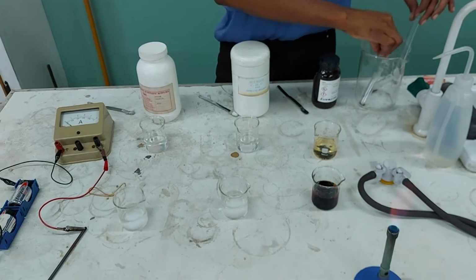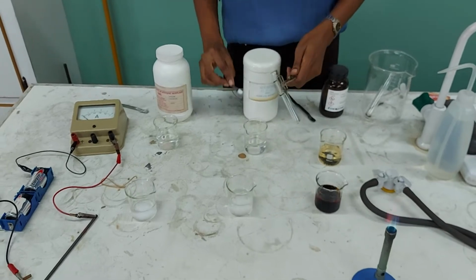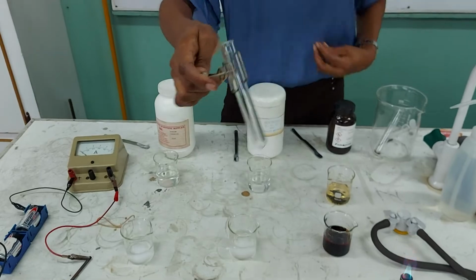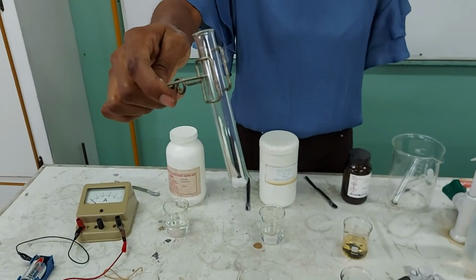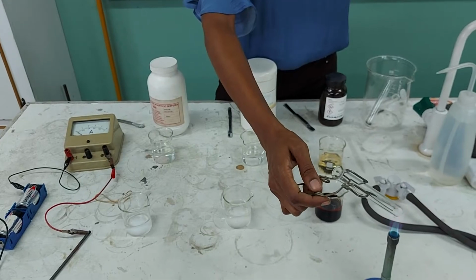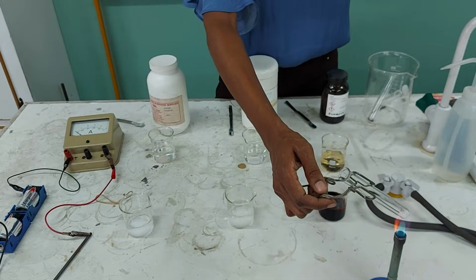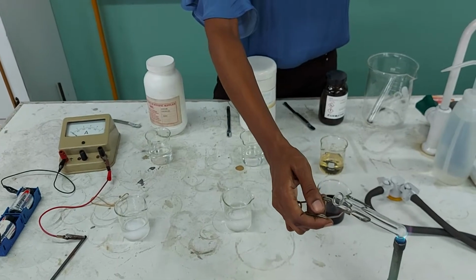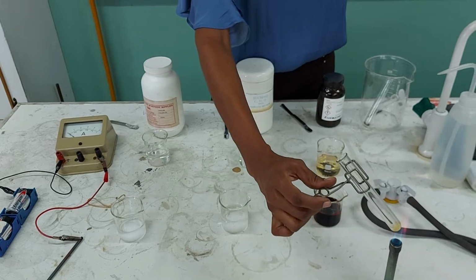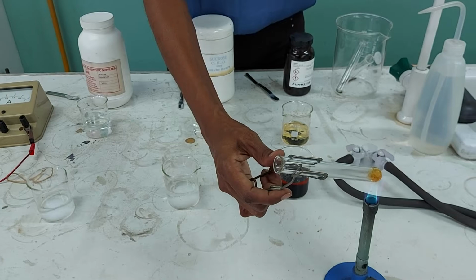Next, we're going to move on to sucrose. So again, I'm going to take sucrose and put it in my test tube, and I'm going to heat it gently in the Bunsen flame. And then I'm going to heat it a little more strongly. I want you to get a very close view and to make all the observations as to what happens here. So what happens here?